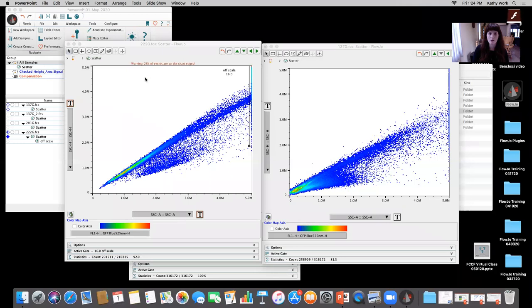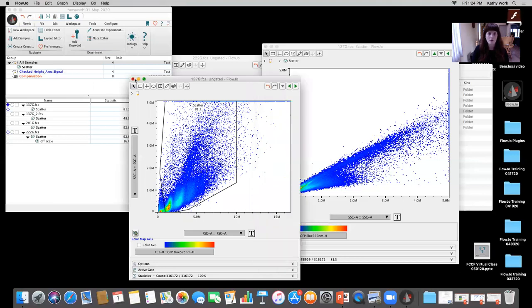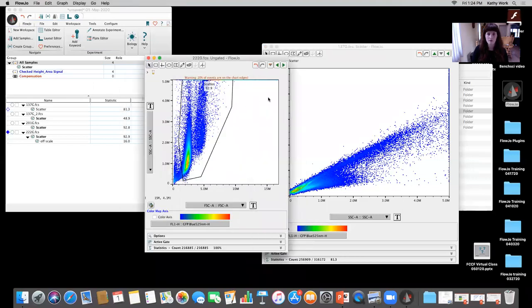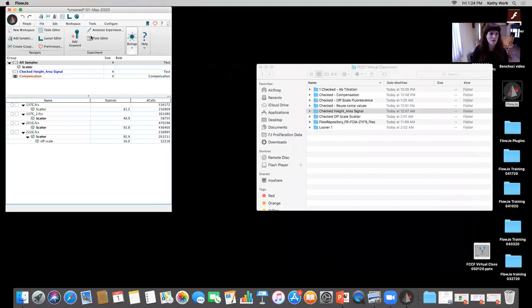So this is just the one example that I wanted to bring up to show you the major differences that can occur if you don't have the detector settings correct and saturation of the signal. Okay, so that's one example.